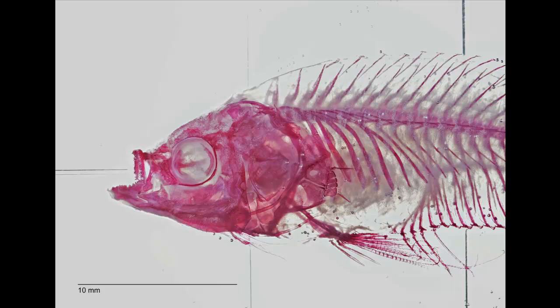Hi, my name is Niels Carlson. This video is about how to use the Visionary Digital System to take pictures of cleared and stained fish specimens. The study that I took pictures for was examining the jaw morphology and mechanics of betta splendens.